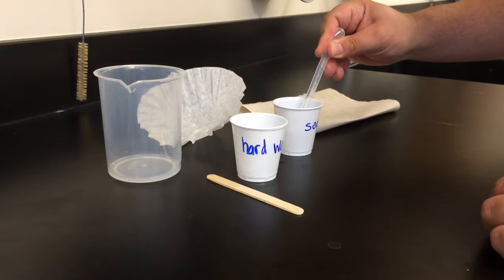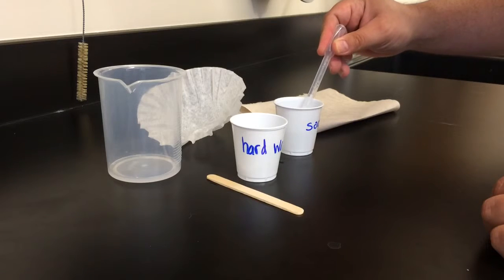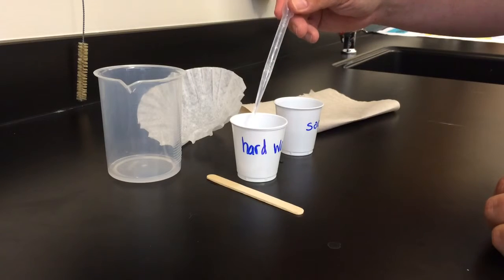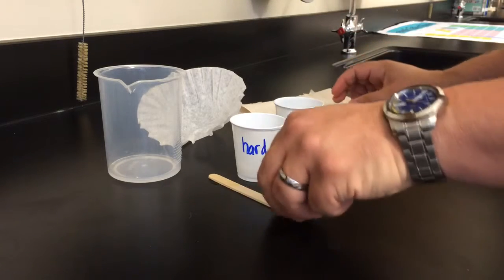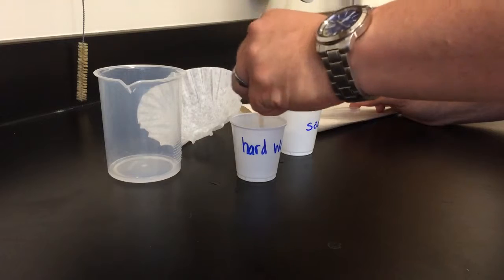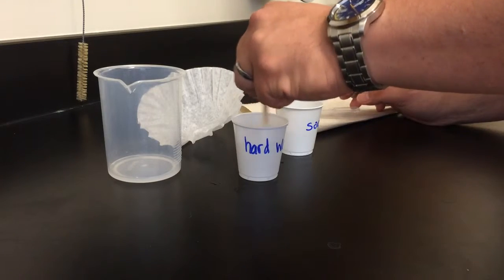So again I'm gonna draw some more soapy water trying to avoid pieces of soap off the bottom so I don't want to disturb it. Put it in there. Okay now I'm gonna give this another stir, let the reaction take place.